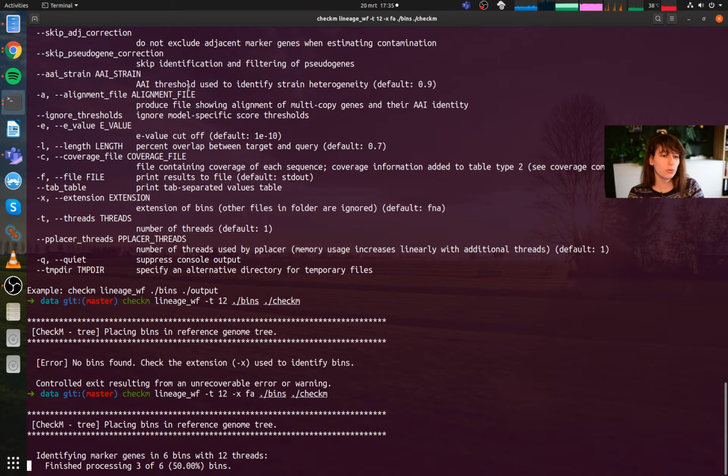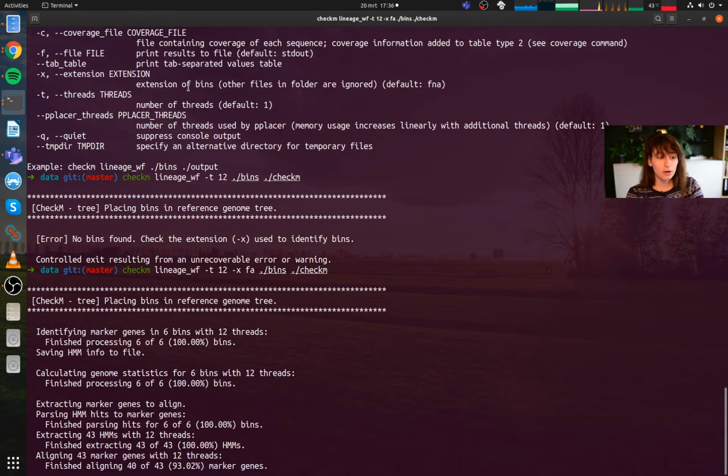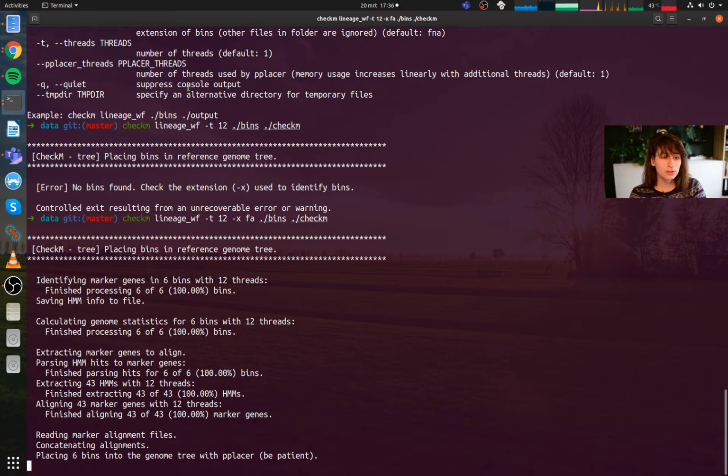Next thing is looking at these genes that it found. It's trying to determine what kind of a bacterium this is. Is this a cyanobacterium, Rhizobiale, something associated to a plant? Is it a Bacteroidetes, E. coli? I don't know. So it tries to be as specific as it can be. If it doesn't know, then it will be unspecific. It tries to find out what kind of bin, what kind of a genome is this, what organism is this. So that's the step that we're at now.